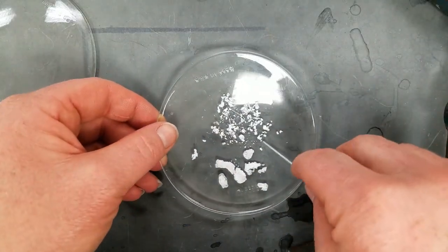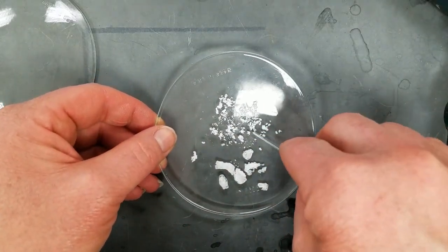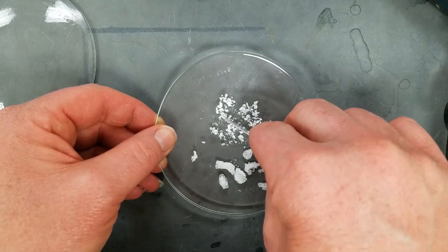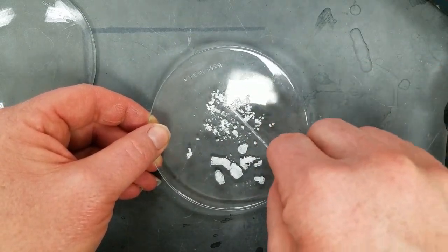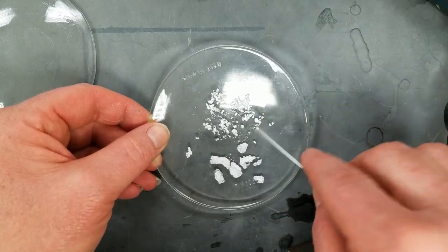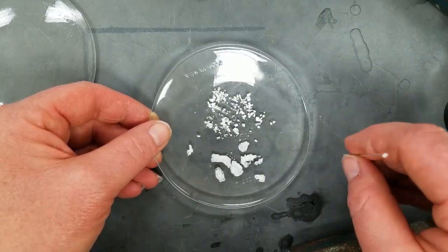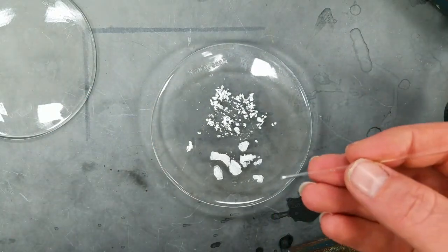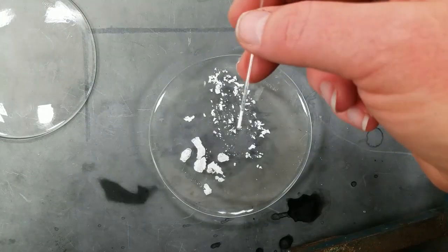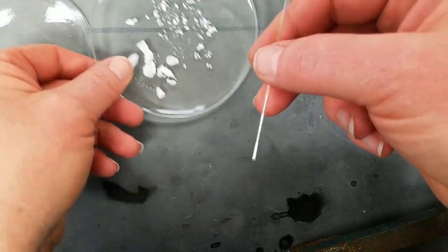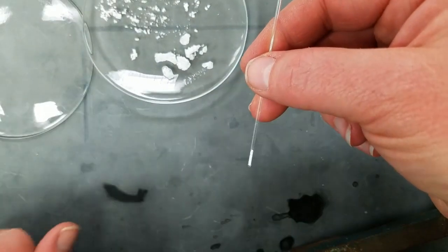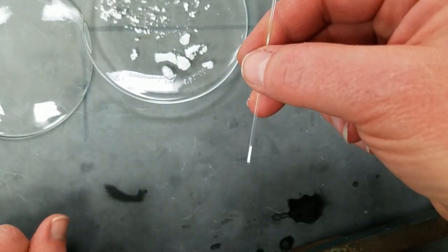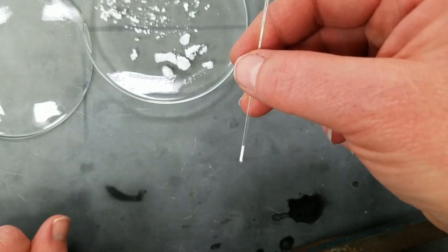We can use the open end of our capillary tube to catch a few of those smaller pieces and tap them down into the bottom to fill our capillary tube. It takes a little bit of time, but eventually you can fill up the capillary tube to a level that allows you to see it in your melting point setup.